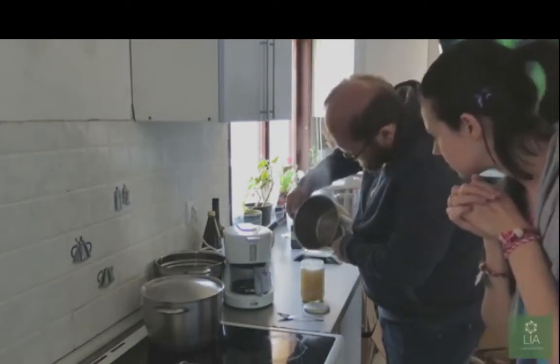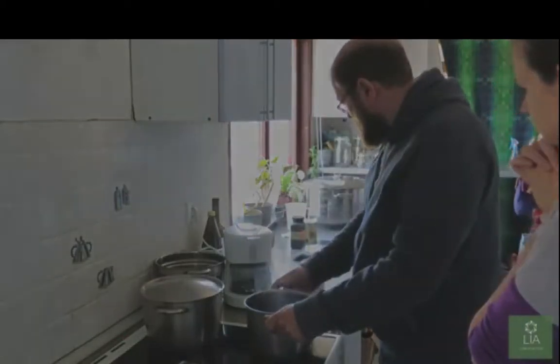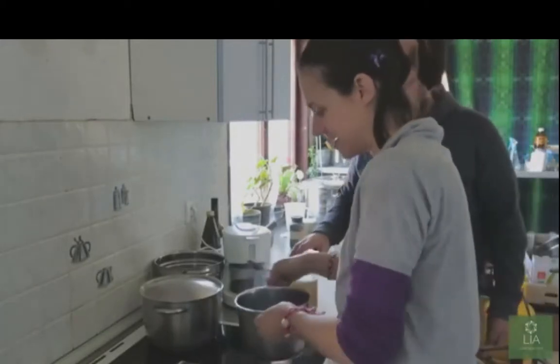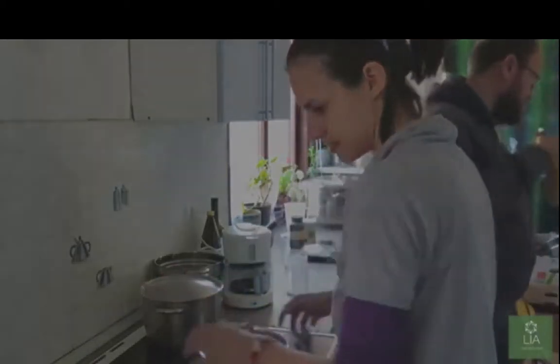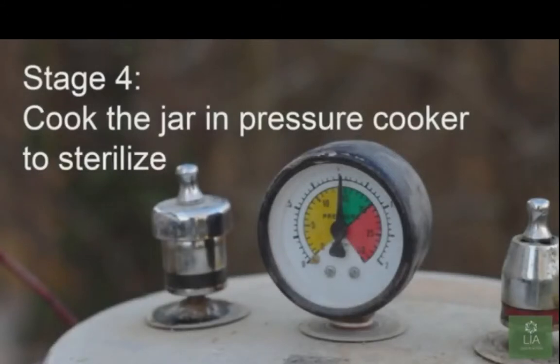Looks like aquafaba. Yeah, we want it to have a hole, or else it will explode when it steams off. Okay, so let's go put you in the mix. Yeah, this pressure cooker looks like it was set at 15.